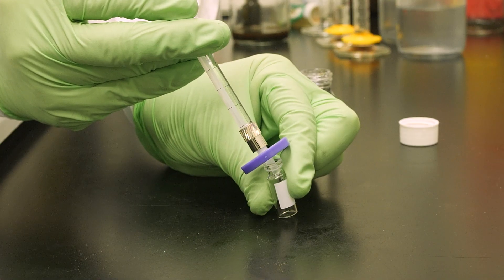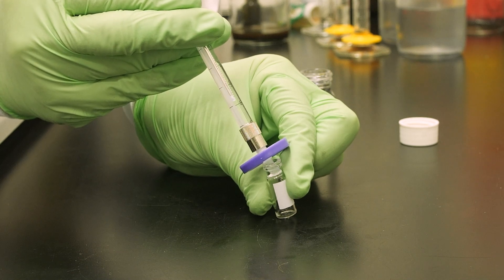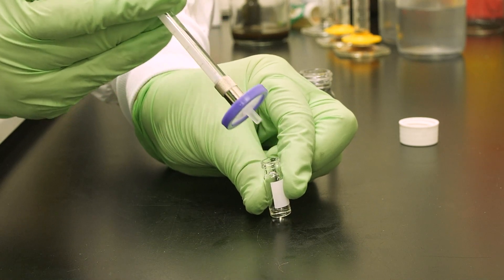Understanding your sample. Some samples, such as those with suspended solids and particulate matter, can build up over time and cause issues with your syringe. Using a syringe filter is a great way to remove these larger particles to stop them from being drawn up into your syringe.